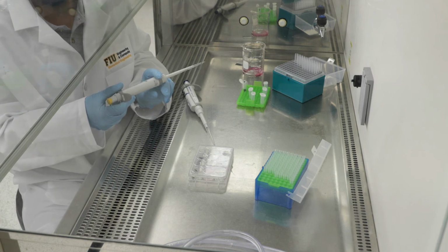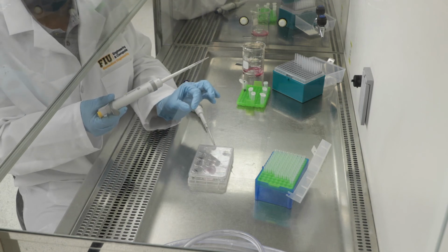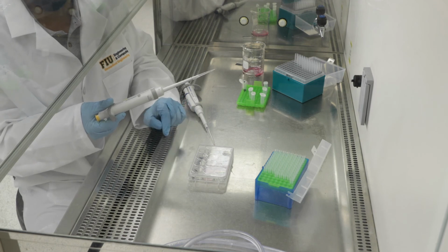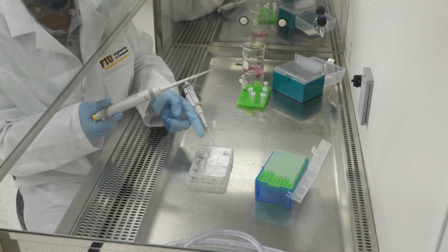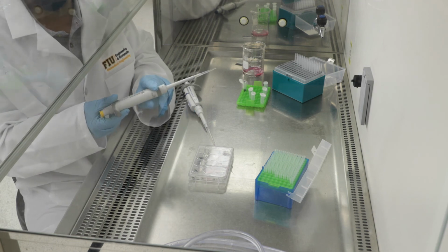So I mix the trypan blue into each of the 4 gel sections, each section being 150 microns thick. And again, at this stage, we would put it in the incubator for about 5 minutes to incubate. Following that, we could then look under a microscope to do our live and dead cell count.